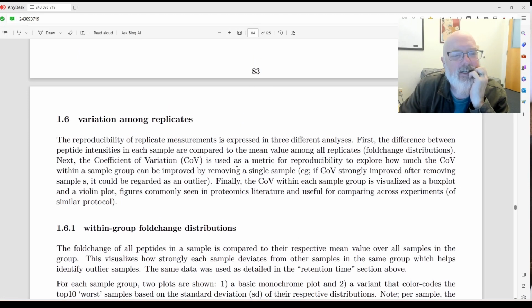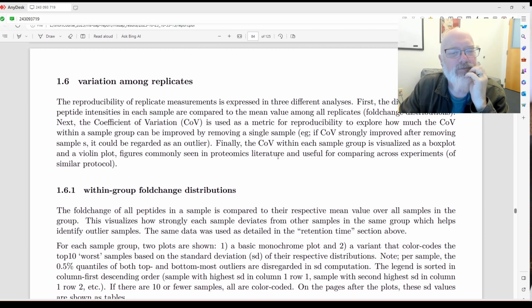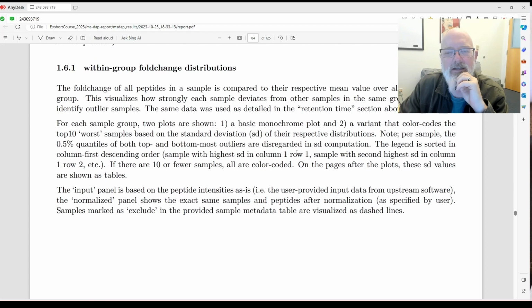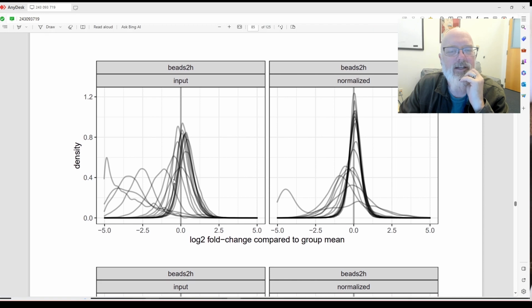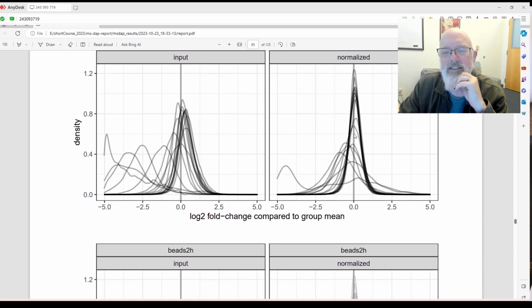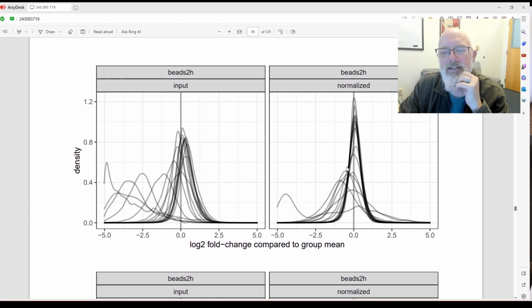Okay, let's see. Variation among replicates. The reproducibility of replicate measurements is expressed in 3 different analyses. First, the difference between peptide intensities in each sample are compared to the mean. Okay. Coefficient of variation is used within group fold change distributions. Okay, that's kind of nice. Let's see. Okay, let's see. Beads. Log 2 fold change compared to group mean. Okay. So you can see how consistent these are within the beads 2 hours. And this is after the normalization of the signal. So they have 2 different normalization procedures in this program, and I'll have to look into the paper about how they work. Okay, so you can see there's a lot of variability in the 2-hour digest. Now it's normalized.